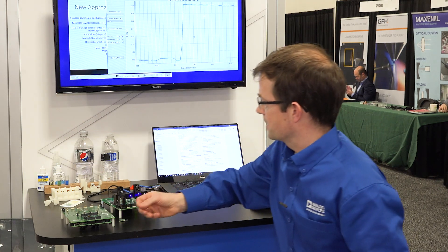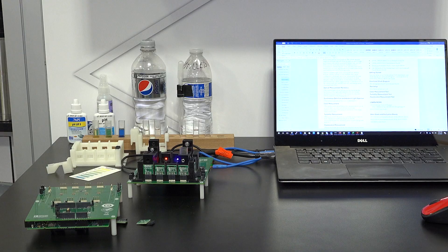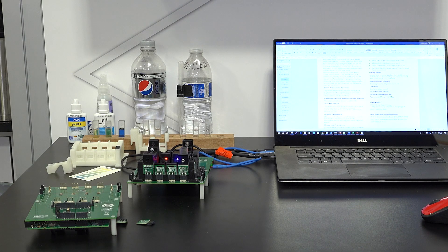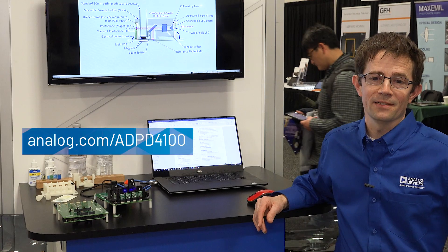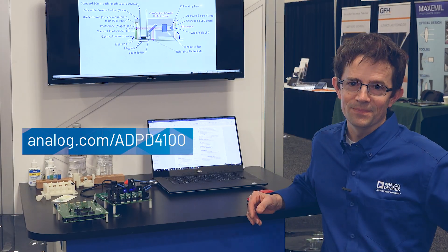With this reference design platform, we can measure any number of water quality measurements, from pH, to how cloudy the water is, to whether or not there's some biomarker that might fluoresce. For more information, visit Analog.com.